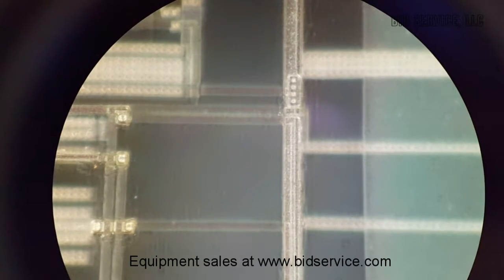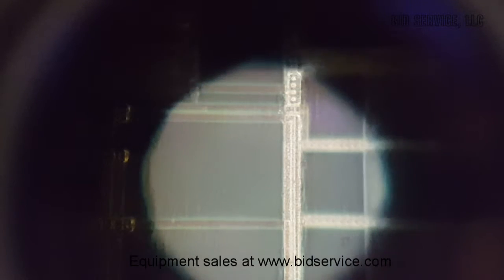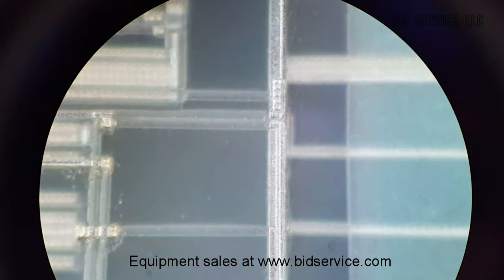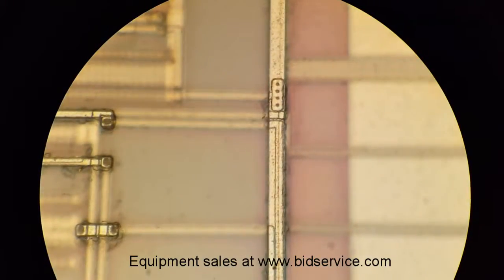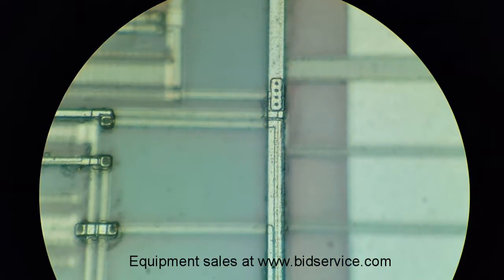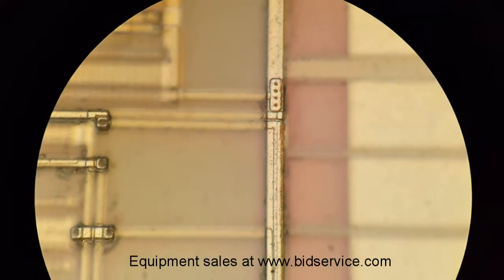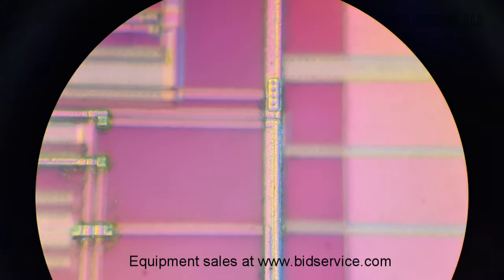There's our field. I'll slide the Nomarski prism in and adjust the knob on it. That was the full range on the prism at 150x.